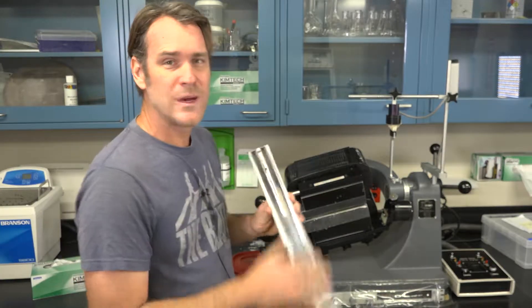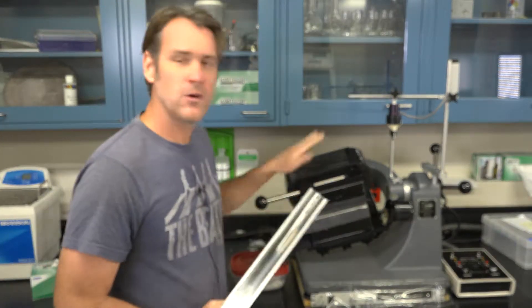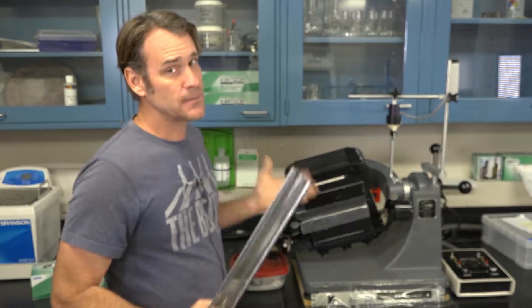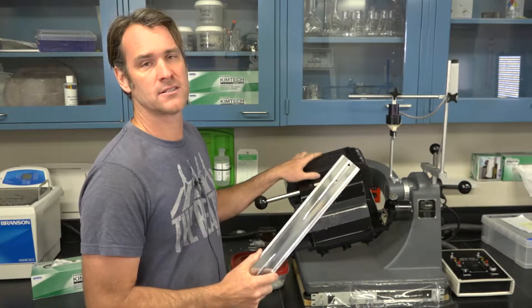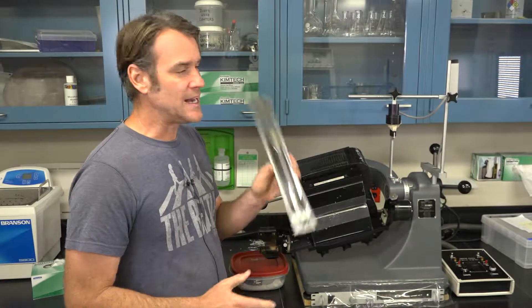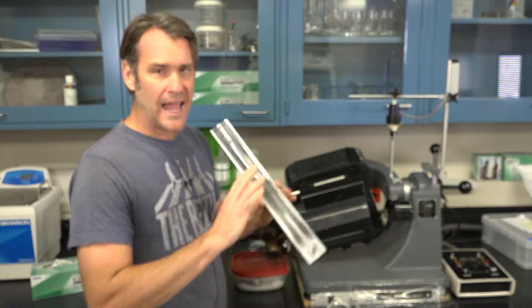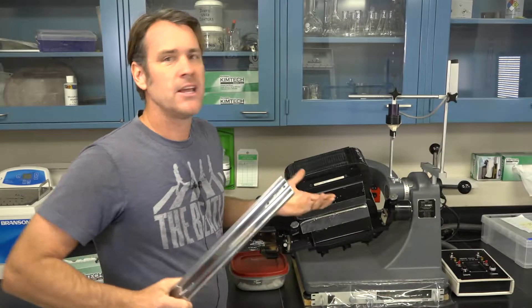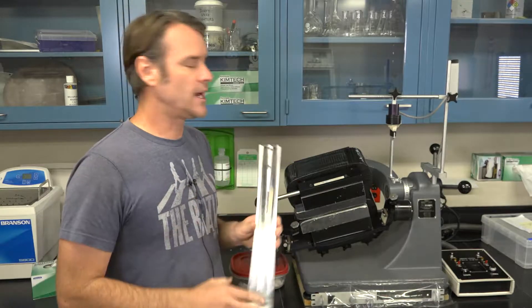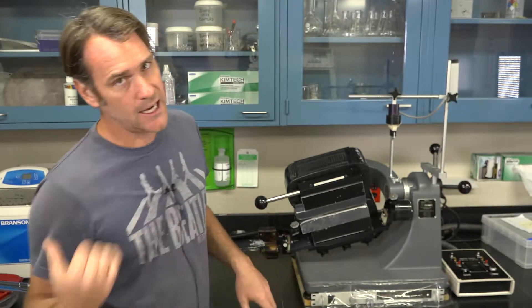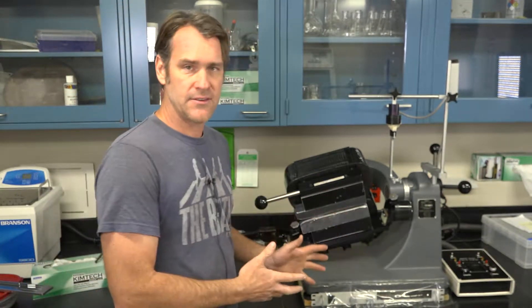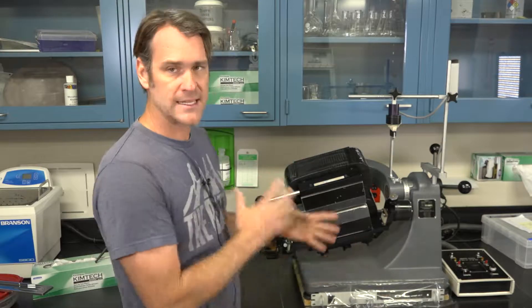First thing you do with any Frantz: make sure you clean all the parts. Especially if you're trying to do analyses on minerals where any kind of contamination will screw you up, make sure that everything is surgically clean. For this video I'm going to show you how to clean at the end, but realize everything has been cleaned before I set it up.